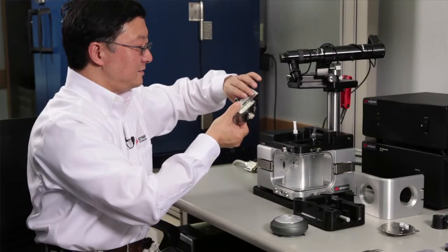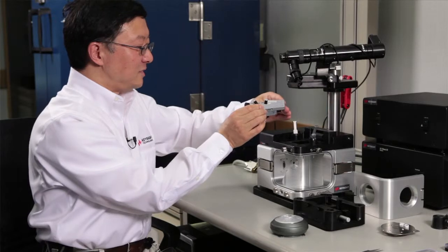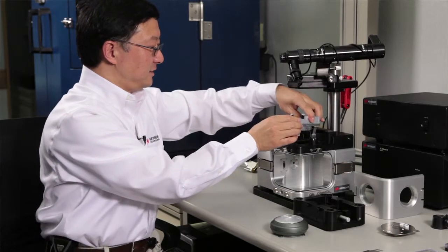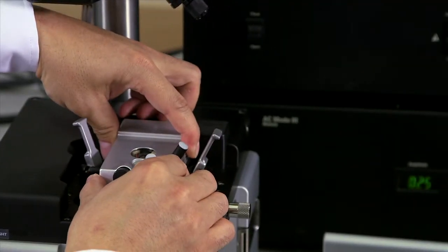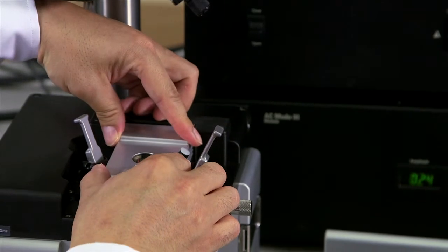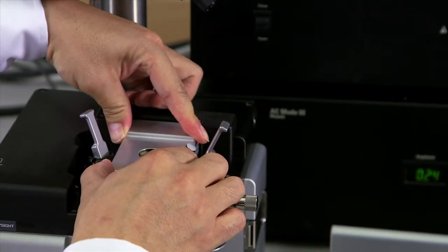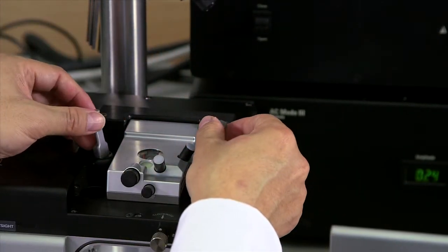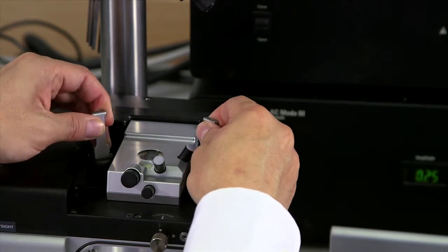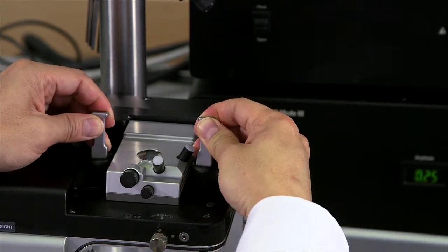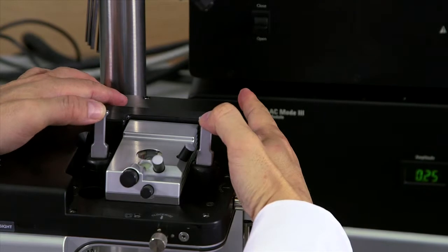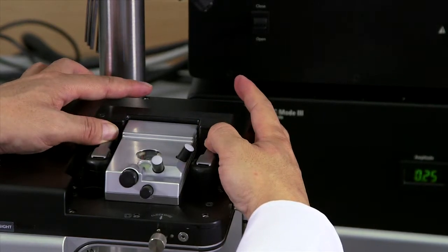You point the nose down and adjust the knob toward yourself and insert into the body all the way. So, rotate the two levers to its parallel position and push down to lock down the scanner itself.